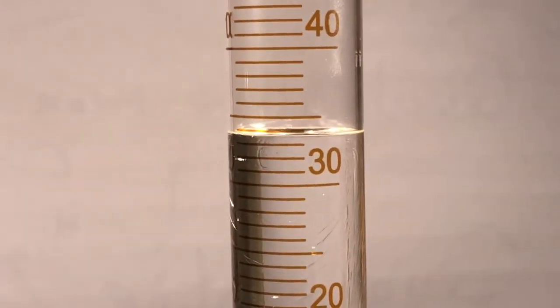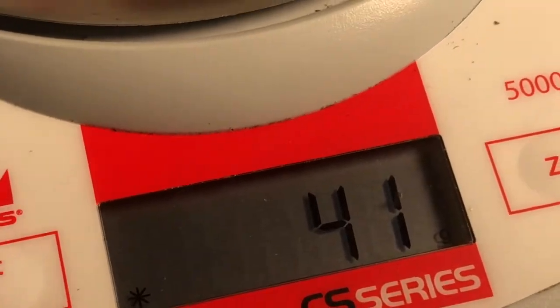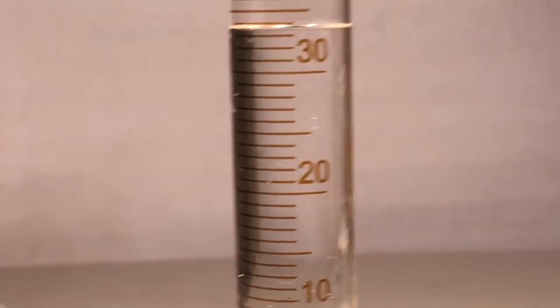Forgive me, I'm tired. Had a long day. All right, what's that say? Eyeball right there. What's that say? And I think that's 6. So I think I've got 7 and 8 coming at you yet, you guys. If I give you 9, well, you'll forgive me.